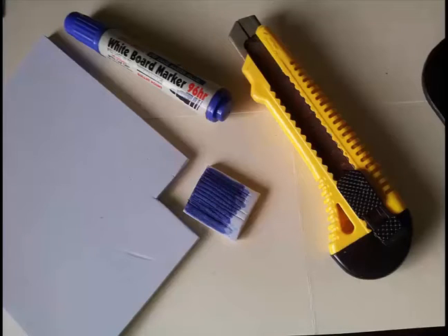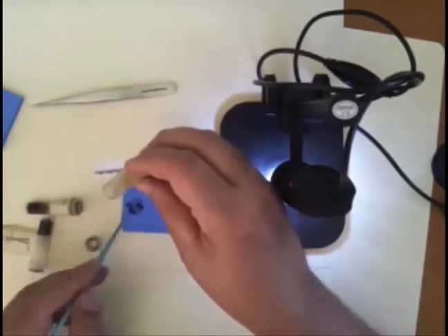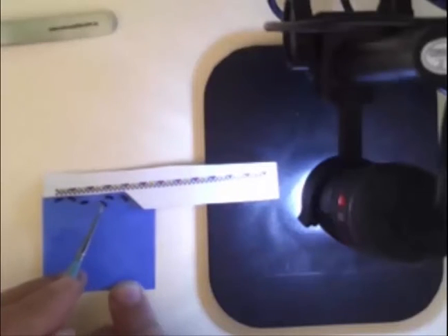I've also found useful a piece of scored foam rubber, which makes it easy to get a dorsal view of the specimen. I'll get the specimens out of the ethanol and blot them on the back of a post-it note. You really do need the specimens to be dry to get a proper view of the colour.